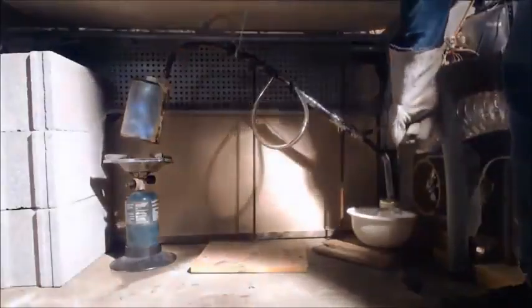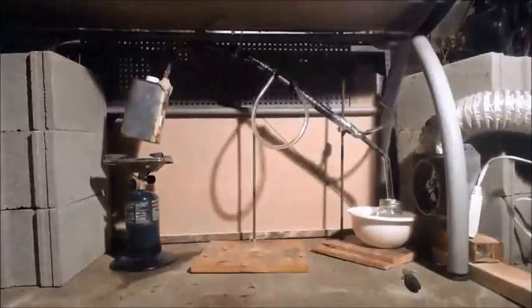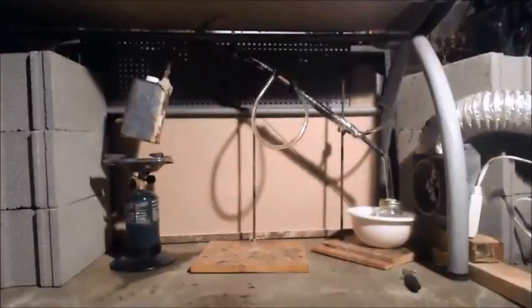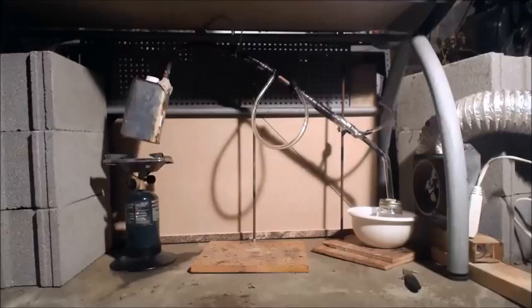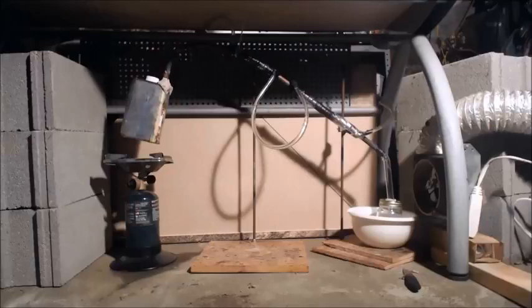You can see over here, I got it taped up and goes into that jar. I did do a blast shield with cinder block all around it. The back has wood, but it's real thick wood. It doesn't catch on fire easy. And there's cinder block behind it to hold it, weight it down.